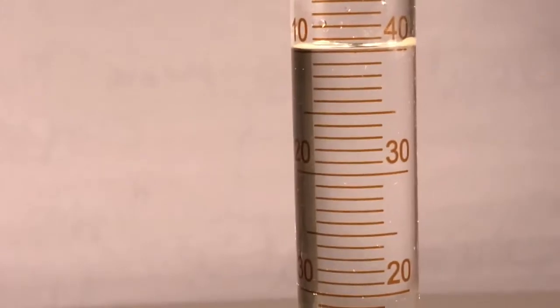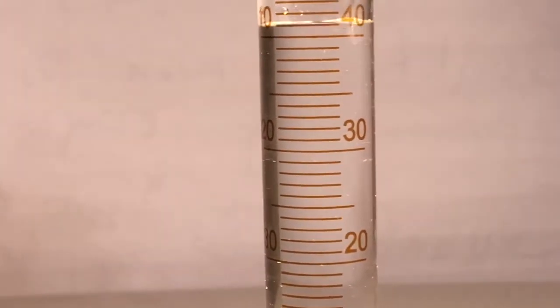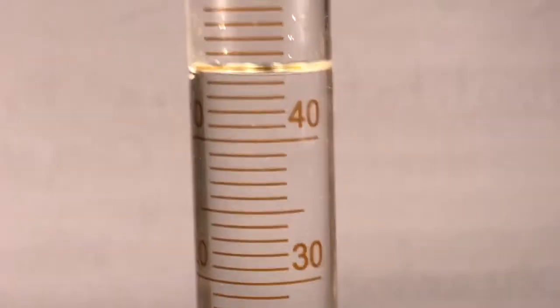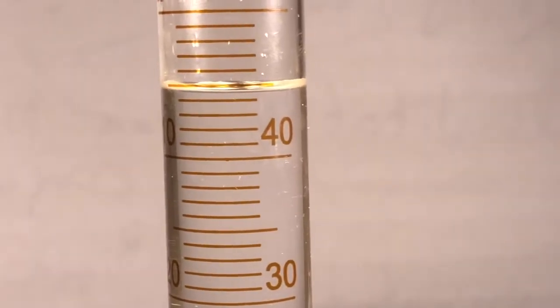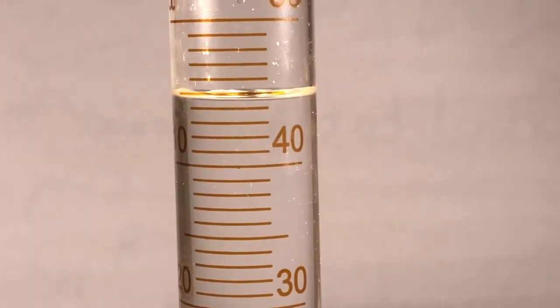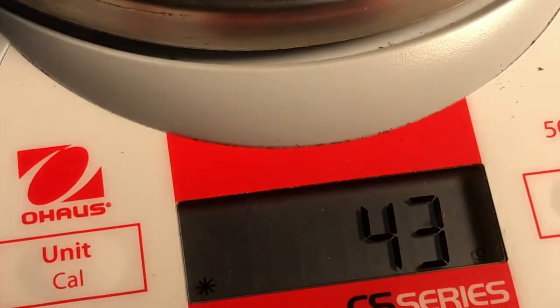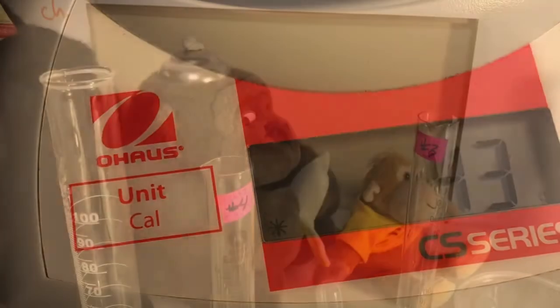Last one, here we go. A massive kersploosh, up near the 50-ish. That's it, I'm done. What do you got? Ooh, that's a fun one. Yeah, you got to pick that number, right? And the mass. There you go. That's data set 1.